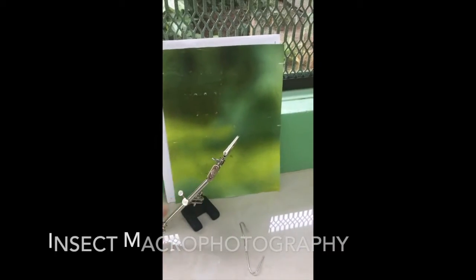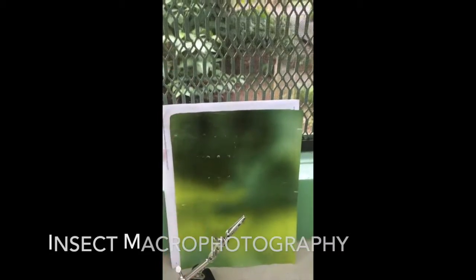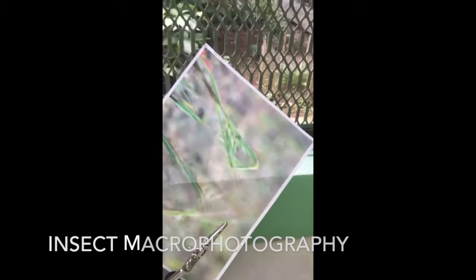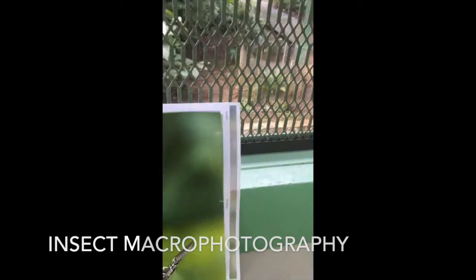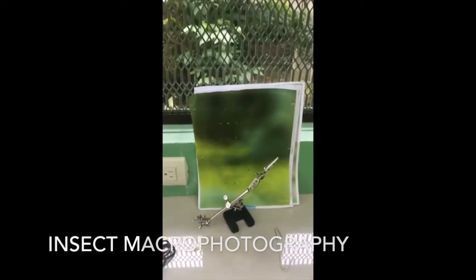We have a soldering holder here, and it's just a clip that we clip the host plant to. And then we have a blurred background that, in a picture, looks like a natural setting. So we have different options depending on what kind of landscape. These ones are kind of torn up. But depending on the landscape or the ecosystem we are in, we can use different backgrounds. So next I will show you this process.